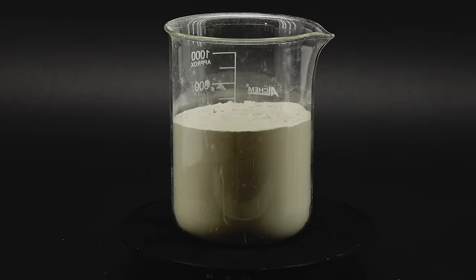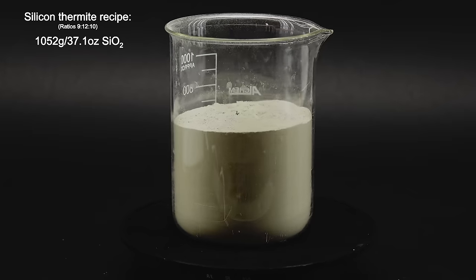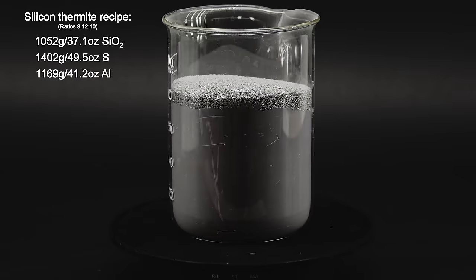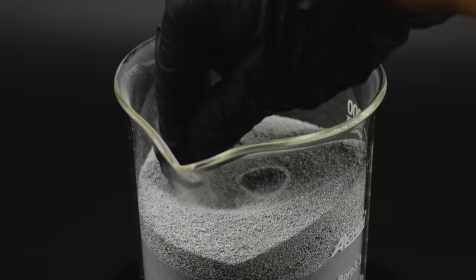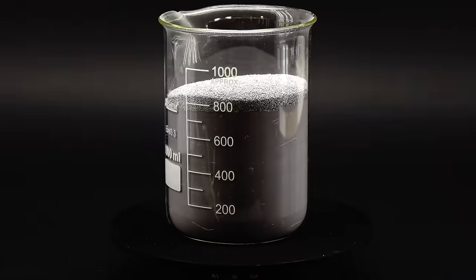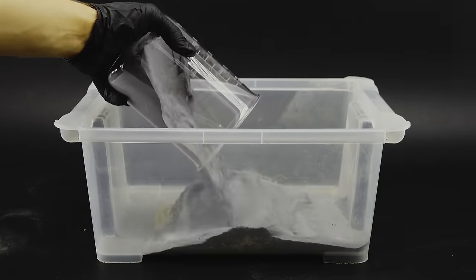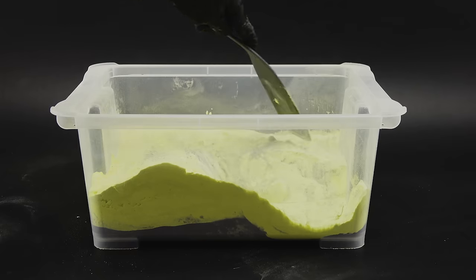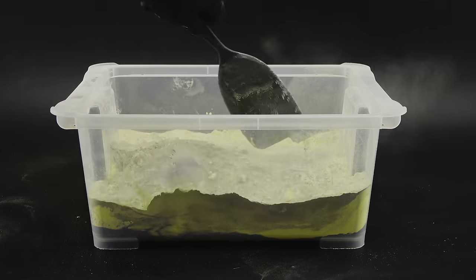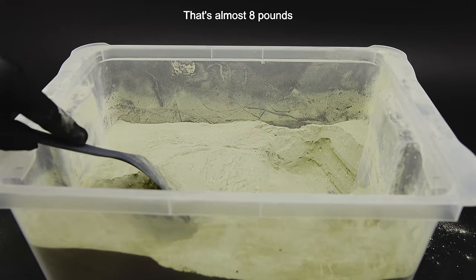Now I can finally make my silicon. For the reaction to work, apart from my lab sand, I will need some sulfur and aluminum powders. To react my whole 1,052 grams of sand, I ended up needing 1,402 grams of sulfur and a whopping 1,169 grams of powdered aluminum, which I had to scavenge my lab for. Powdered aluminum is absolutely required for this reaction, and it's very rare and expensive to buy where I live. I got all the ingredients into a plastic container to mix them, and after about half an hour the powders were now pretty evenly mixed. It was honestly pretty scary to see 3.5 kilos of a thermite mix in one place.